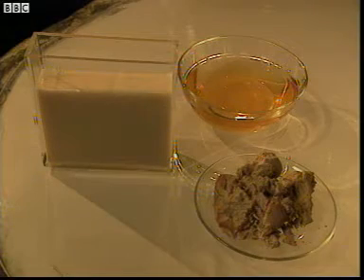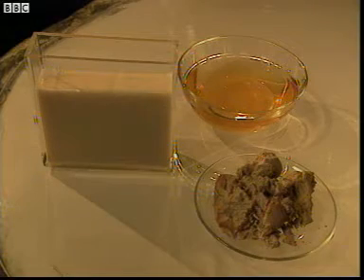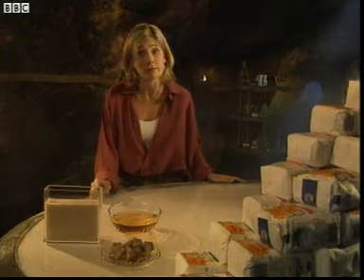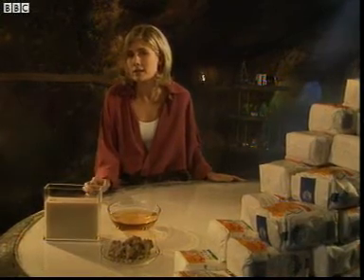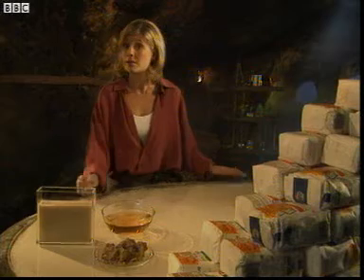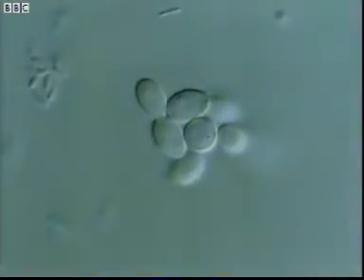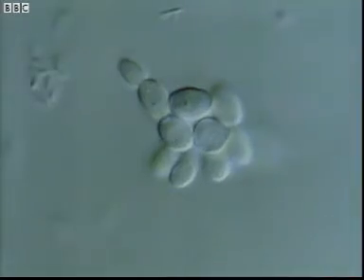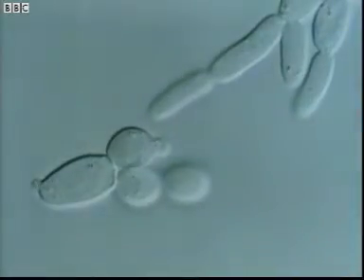This is yeast cells mixed with a sugar solution, and it's part of the process of making beer. Every single living cell gives off gas, so the more cells there are, the more gas is given off. Bubbles show that the yeast is respiring rapidly to release energy for cell division, and under a microscope you can see the cells rapidly dividing, much faster than the urchin cells we saw earlier.